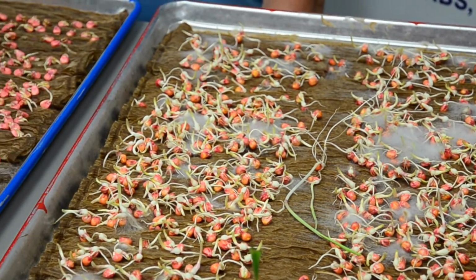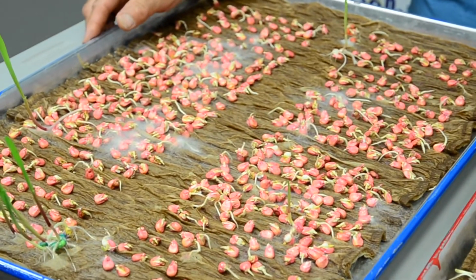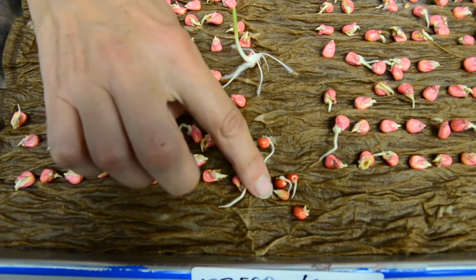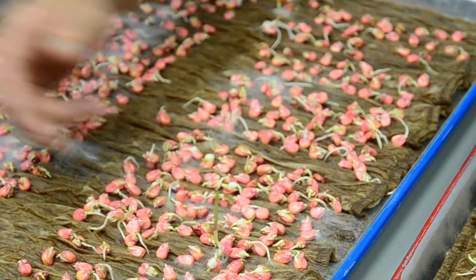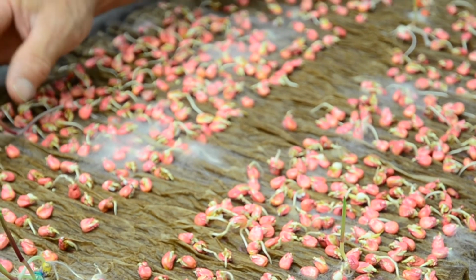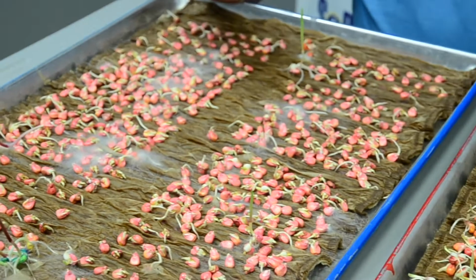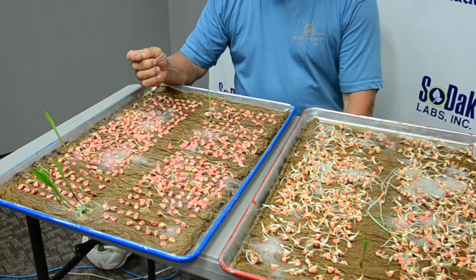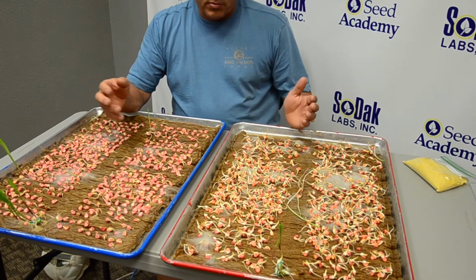Switching over here to glufosinate, or Liberty, you also have 1,200 seeds with your positives and then your negatives back here. And you can see, again, it just happens to be the same number, 3 herbicide tolerant plants in this. So this might be like conventional seed corn that the seed company is sending in to test. And so here we have a really low level, 3 out of 1,200 in each of these 2 tests.